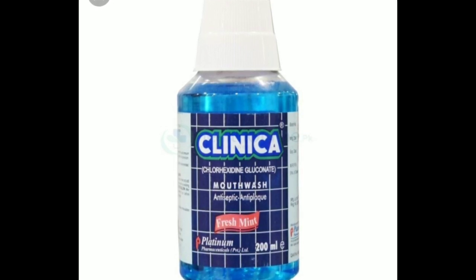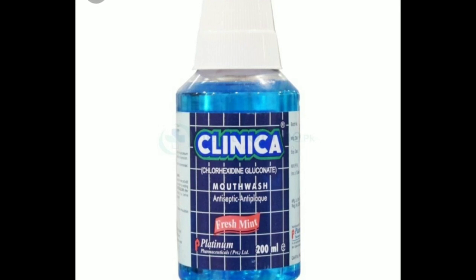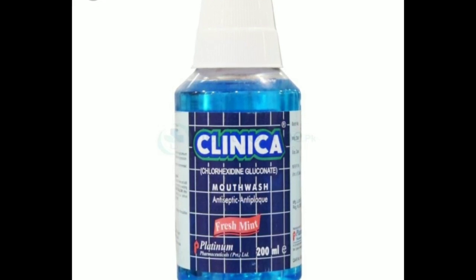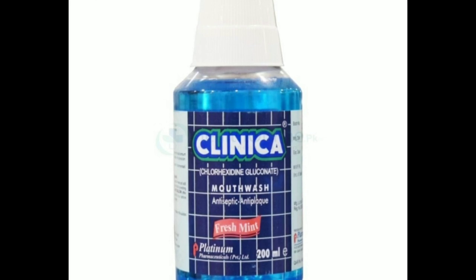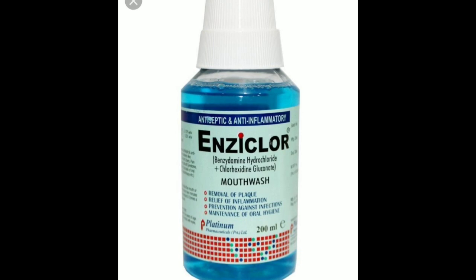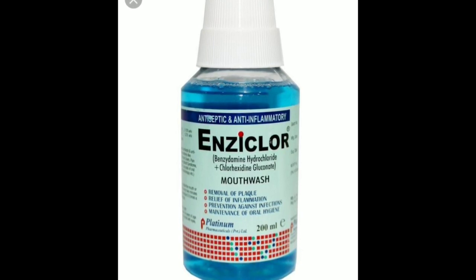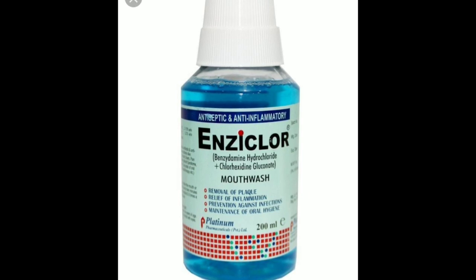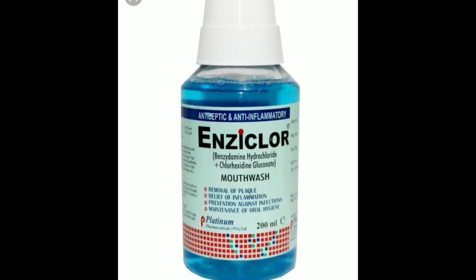These are the most common fortified drops used in ophthalmology. I hope you will now be able to make chlorhexidine, amphotericin B, fluconazole, ceftazidime, vancomycin, gentamicin, and tobramycin fortified drops with ease. Thank you very much.